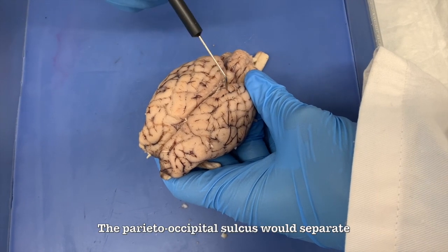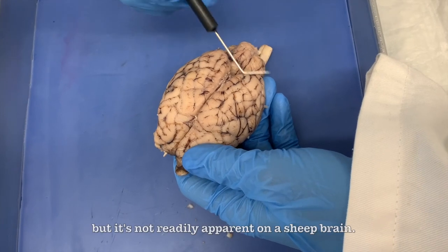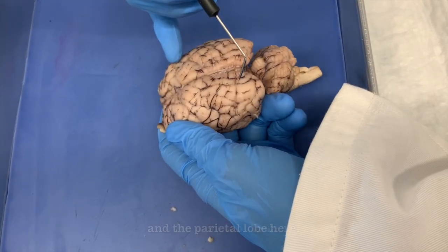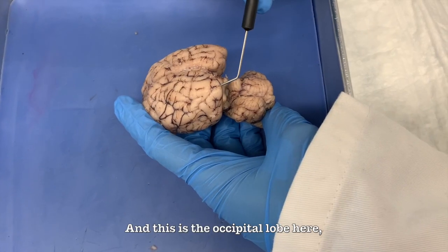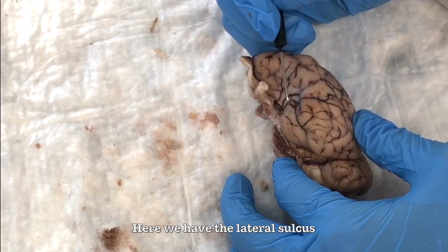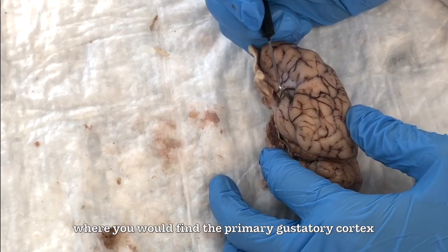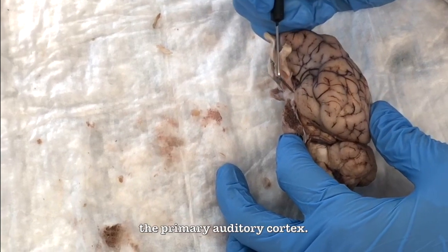The parietal occipital sulcus would separate the parietal from the occipital lobe, but it's not readily apparent on a sheep brain, but it would be found between the division of the occipital lobe, which is found here, and the parietal lobe here, so it would run laterally across both hemispheres again. And this is the occipital lobe here, which is where you would find the primary visual cortex. Here we have the lateral sulcus that separates the temporal lobe from the frontal and parietal lobes. And deep to this, you can find the insula, where you would find the primary gustatory cortex. And in the temporal lobe, you have the primary auditory cortex.